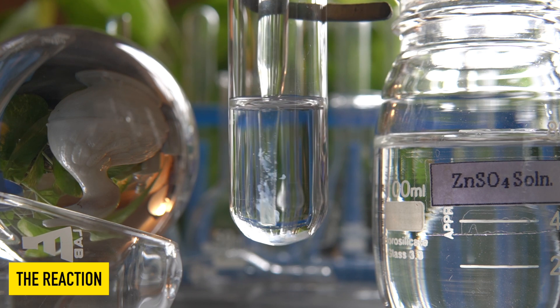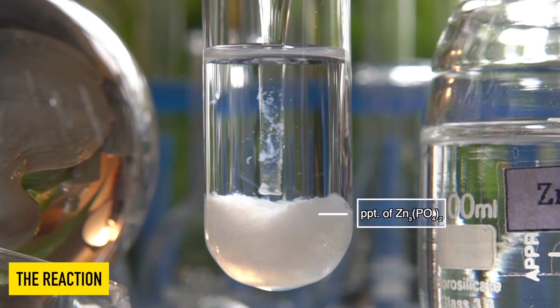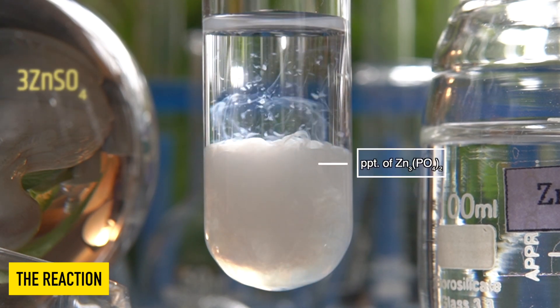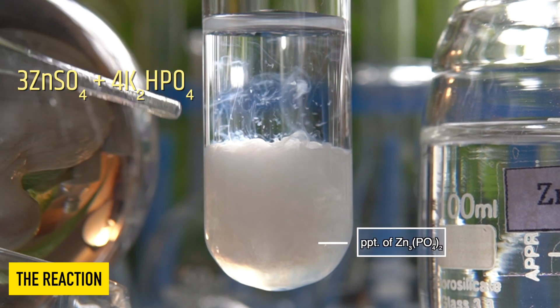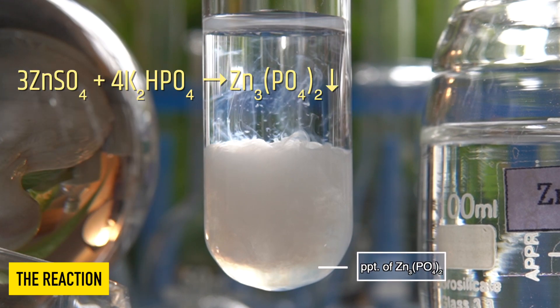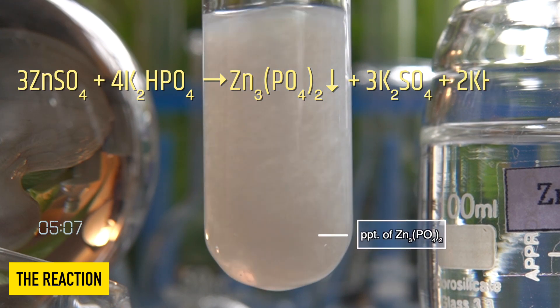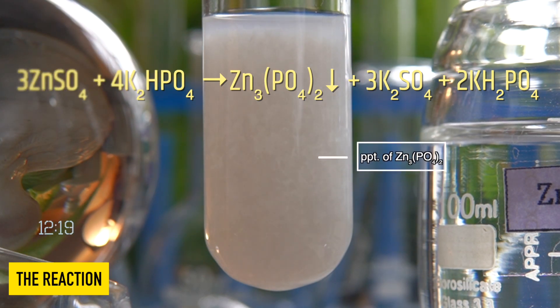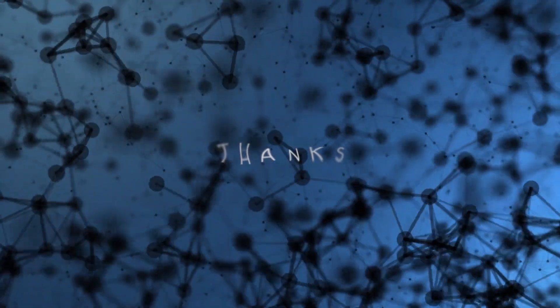The insoluble white precipitate that has been formed at the bottom of the test tube is zinc phosphate. In this reaction, zinc sulfate reacts with dipotassium hydrogen phosphate to produce an insoluble precipitate of zinc phosphate along with potassium sulfate as a byproduct.